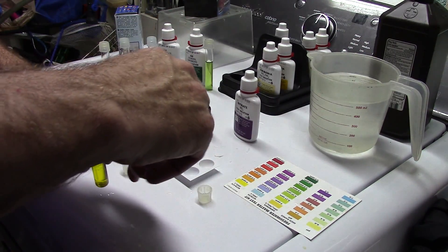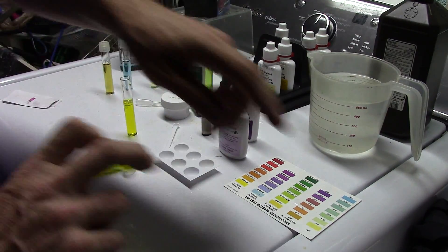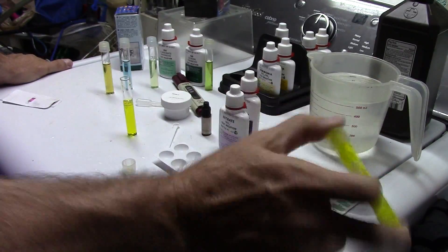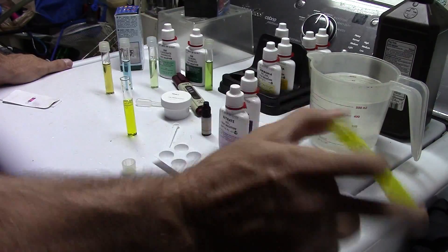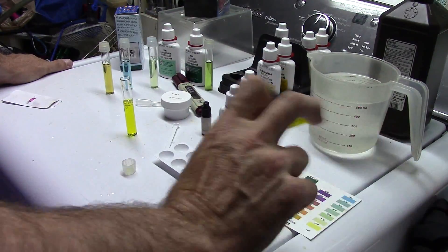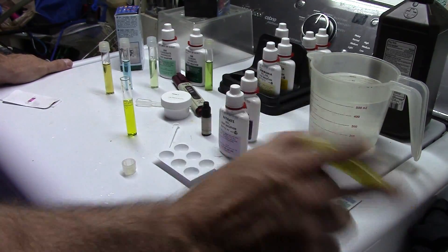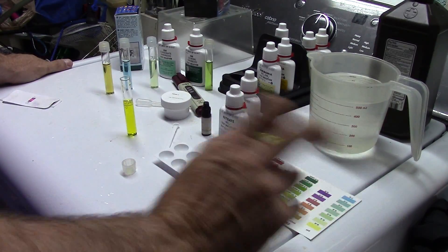You need to do 10 drops. I do not believe that once these drops are in the solution it needs to be shaken vigorously — I think as long as it stays in motion for one minute you'll be fine. So we are going to do this for one minute, then do another one where I simply invert it for one minute, and we'll watch them bloom together.